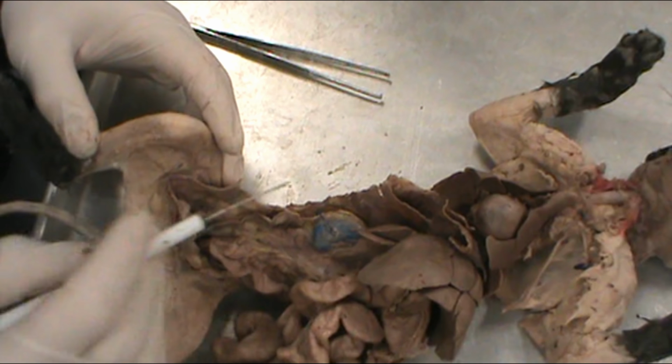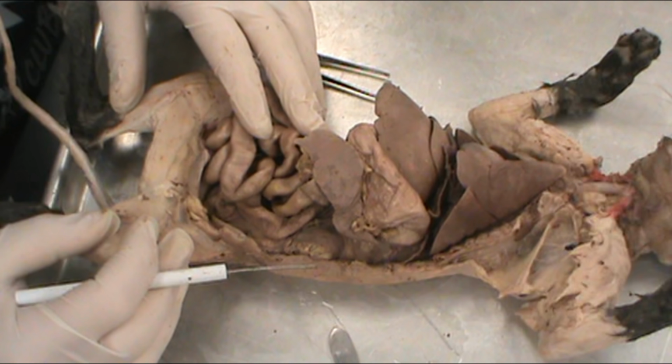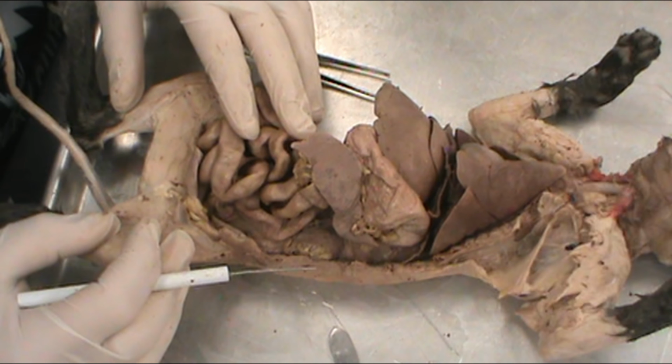All right. So let's take a quick look at the list. Let's see what we are missing, if anything. Mesentery, that's one. So the mesentery is all of this transparent membrane right here that holds all of the small intestine together. So you can see my fingertip, hopefully there. All of this membrane is the mesentery, and it holds all of the intestines in place.